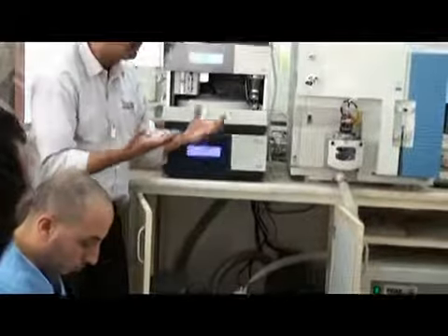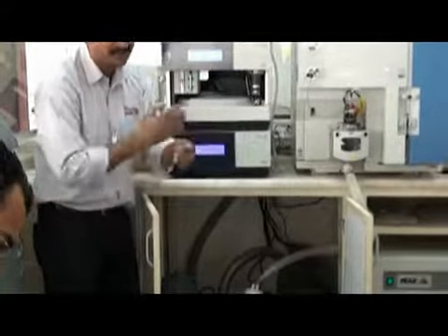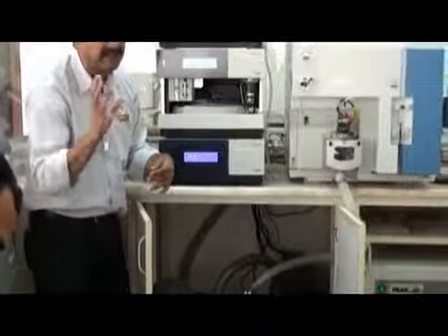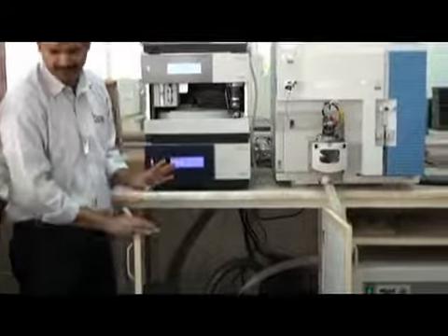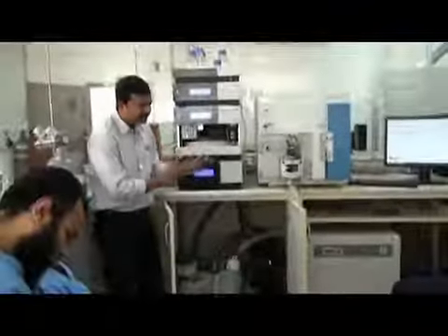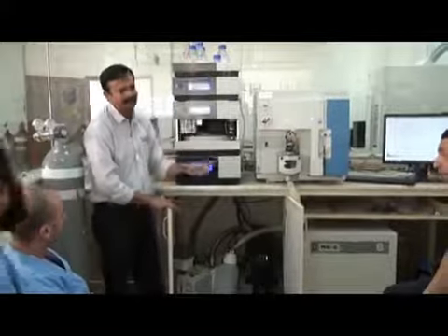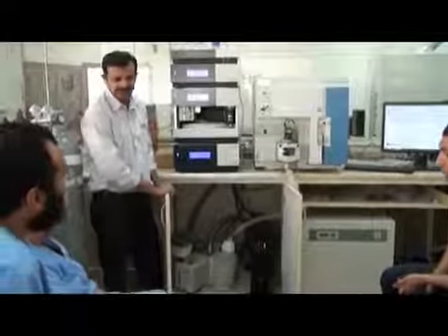A good vacuum comes overnight. If I switch off and then switch on, there is no good vacuum. You need to wait maybe one night, or 4-5 hours minimum, to get a good vacuum. So the system is meant to run like this: always leave it on. You need good electrical power and a UPS.